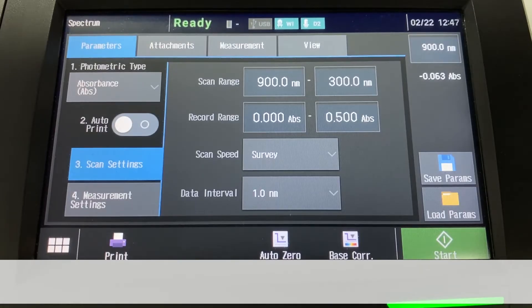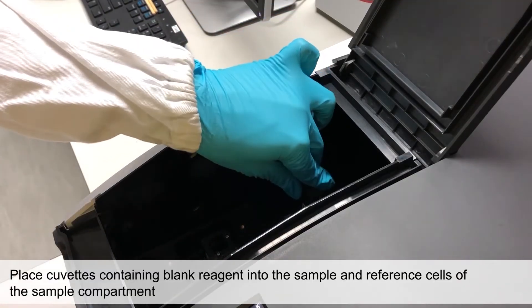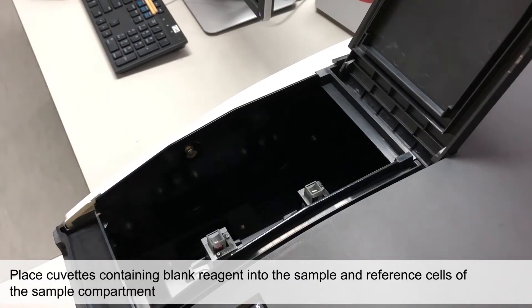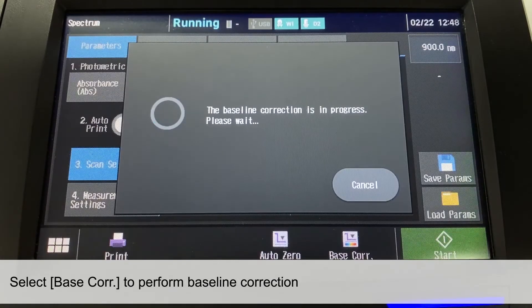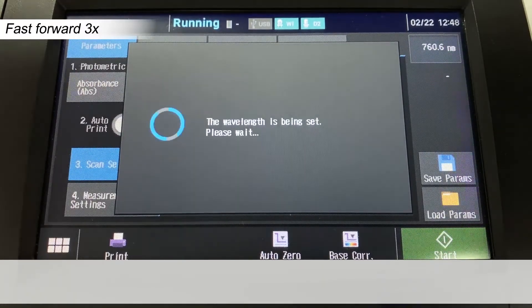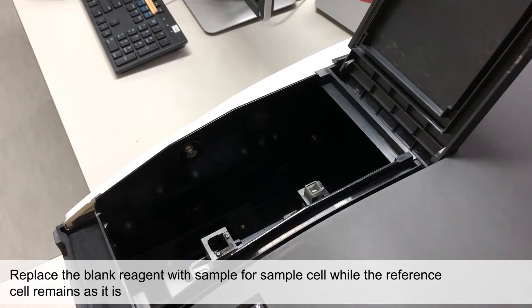Now, we are going to perform baseline correction. Place the cuvette containing blank reagent into both sample and reference cells of the sample compartment. Select baseline correction from the screen. After baseline correction is finished, replace the blank reagent with the sample solution for the sample cell.